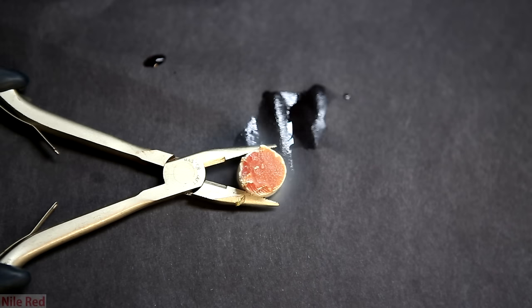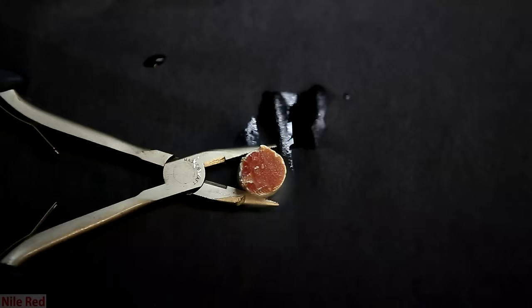This is just a final demonstration to show how white phosphorus exhibits chemiluminescence. When exposed to moist air, the white phosphorus is oxidized and it lets off a very faint green glow. In person it's actually pretty distinct, but on camera it was very hard to pick up.